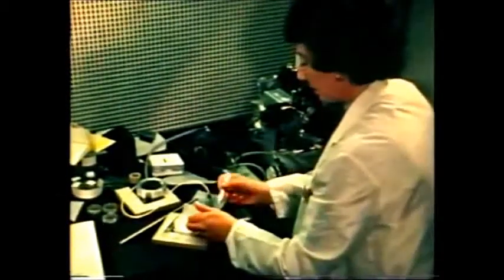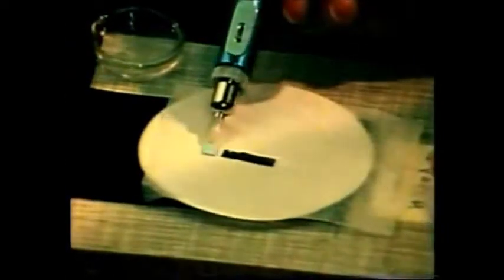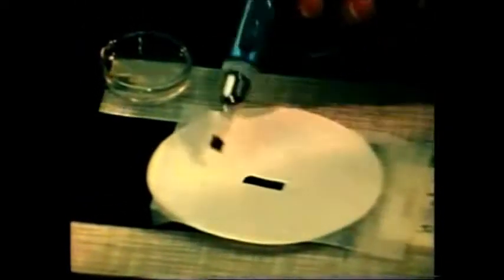One of the major problems facing both the circuit designer and the process engineer is the locating and rectifying of faults which prevent integrated circuits from functioning correctly.